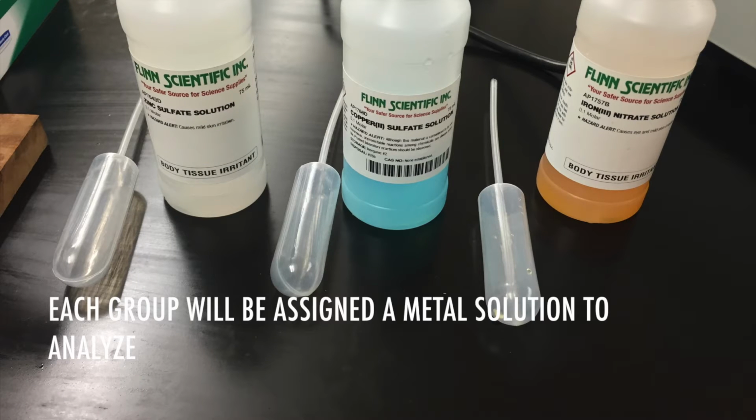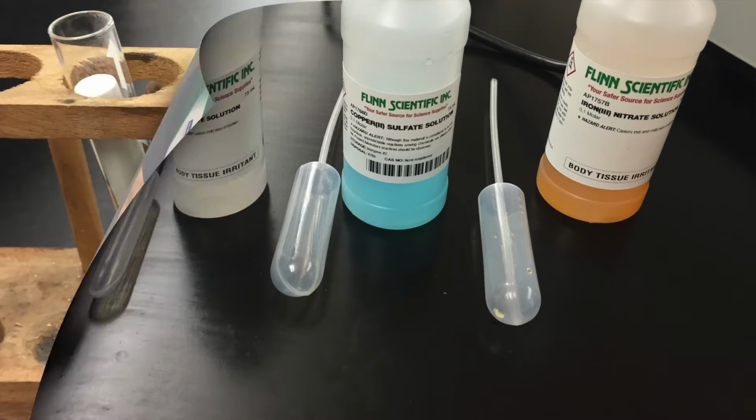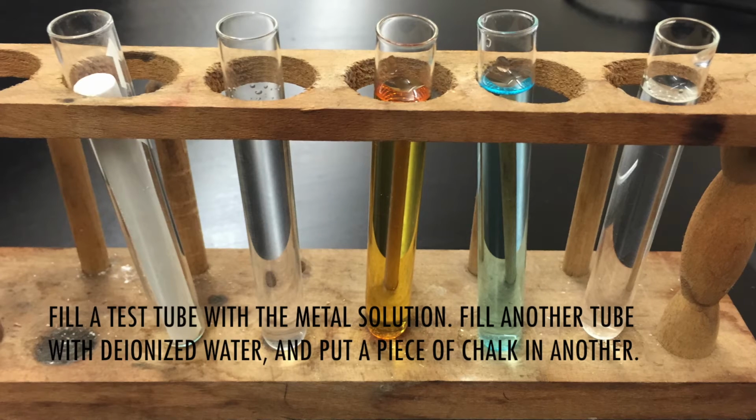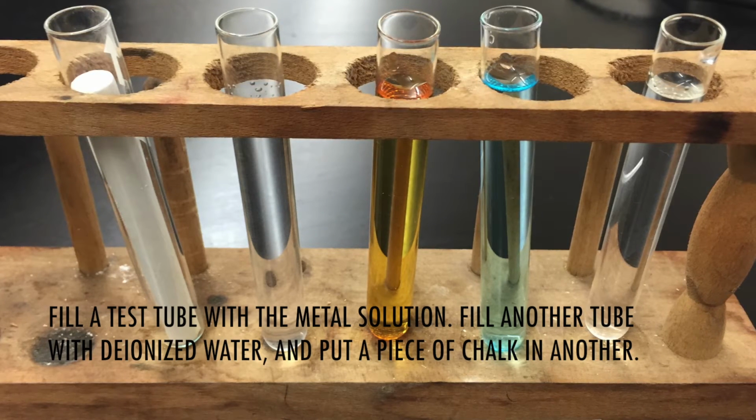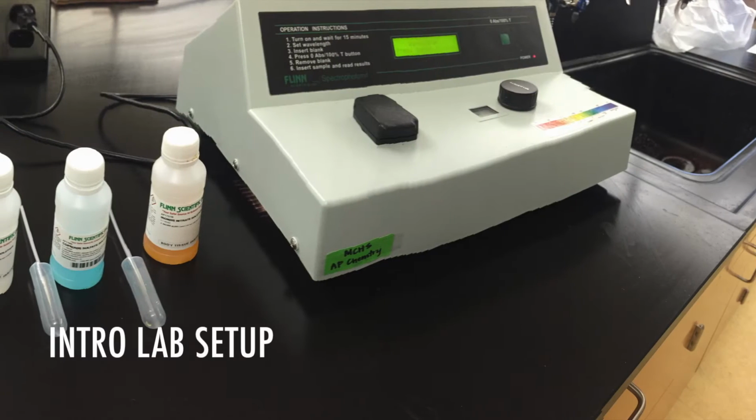Each group will be assigned a metal solution to analyze. Fill a test tube with the metal solution. Fill another tube with deionized water and put a piece of chalk in the other.